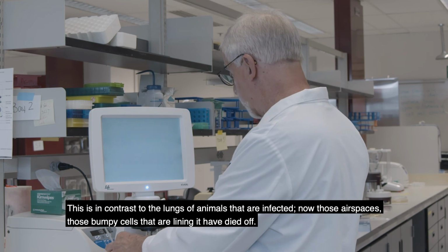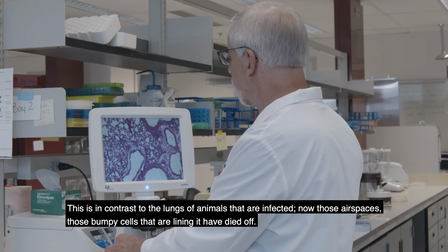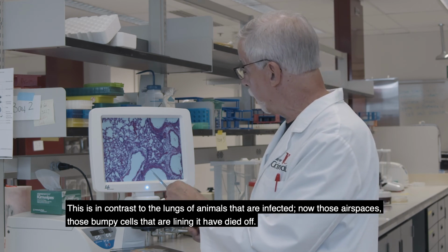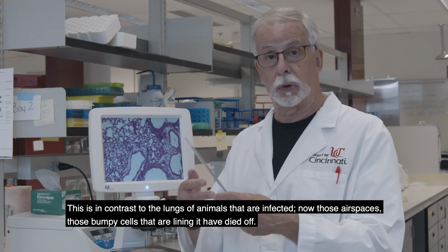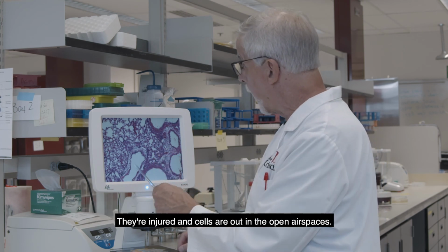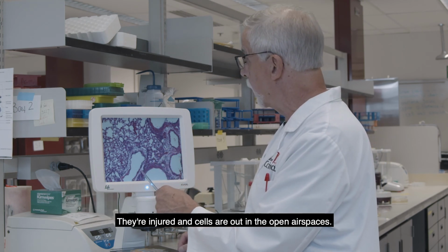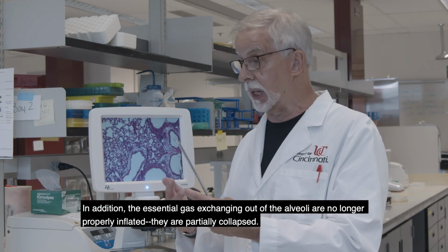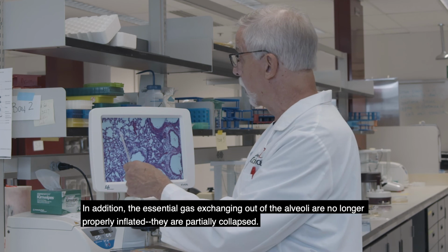This is in contrast to the lungs of animals that are infected, where now those air spaces, those bumpy cells that were lining it, have died off. They're injured, and cells are out in the open air spaces. In addition, the essential gas exchanging alveoli are no longer properly inflated.